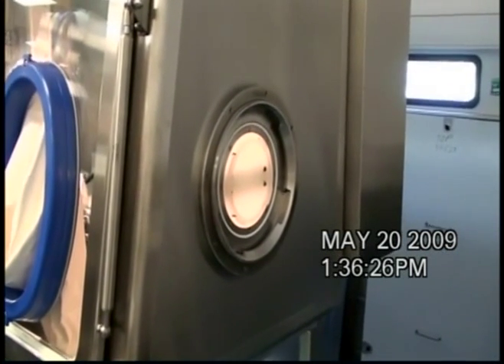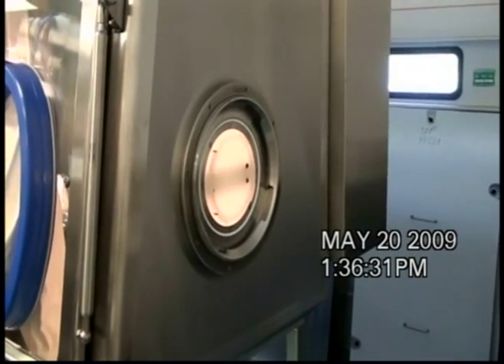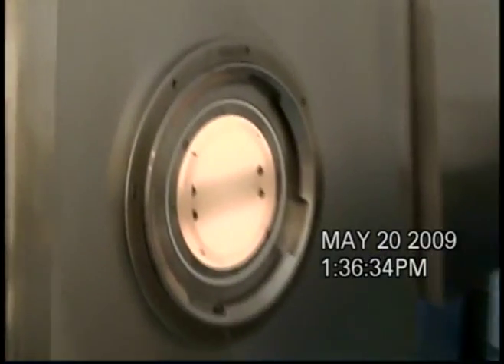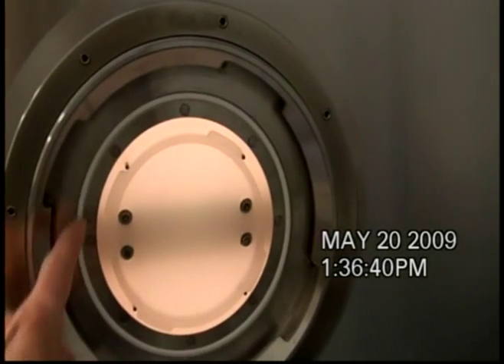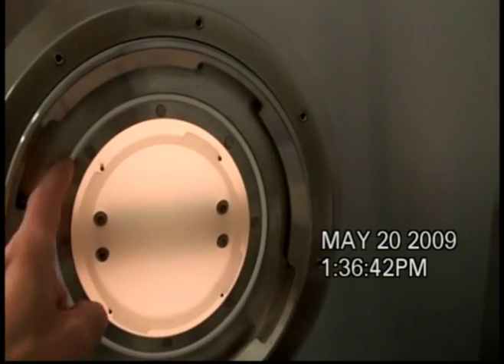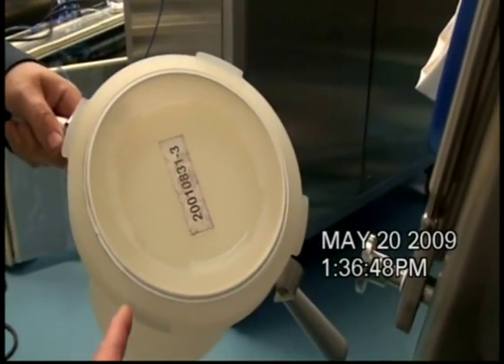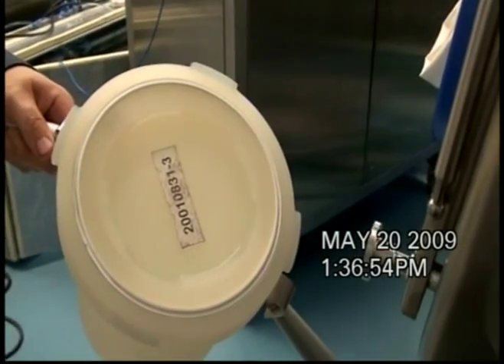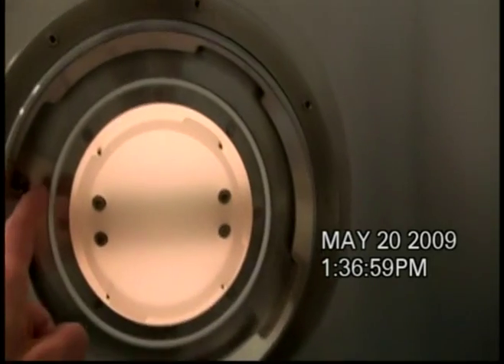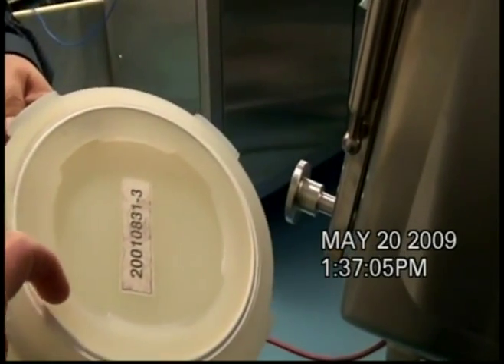The RTP system is a two-part system with an alpha flange and a beta flange. This is the alpha flange from the outside of the isolator. The alpha flange has tabs, slots, and a gasket. Its mate is a beta flange, which also has corresponding tabs, slots, and a gasket. This gasket will seal to the alpha flange, and this gasket will seal to the beta door.